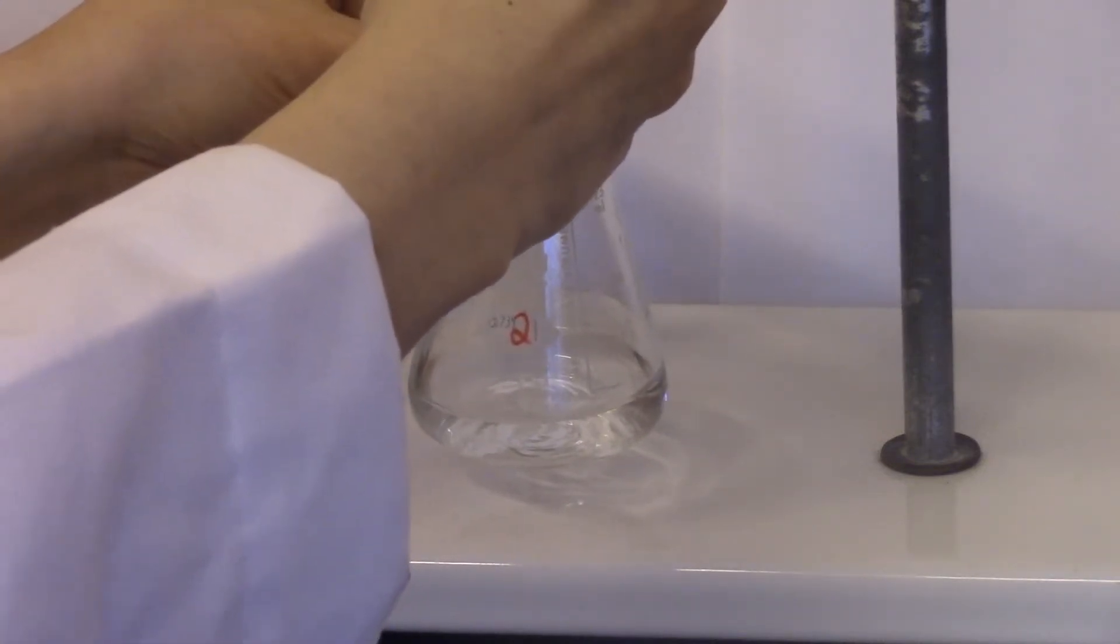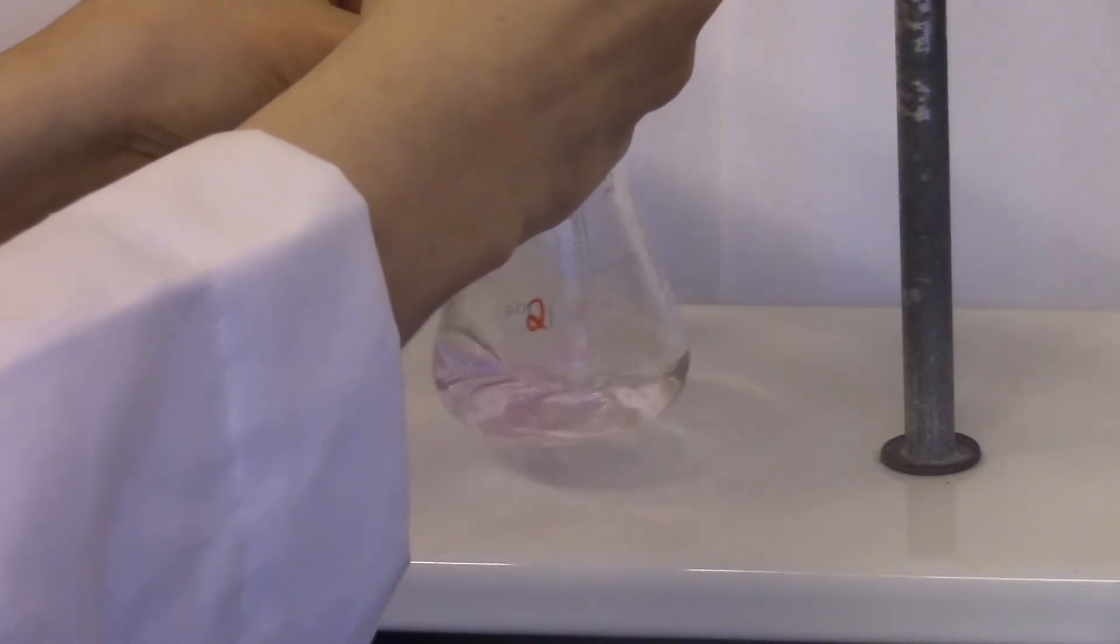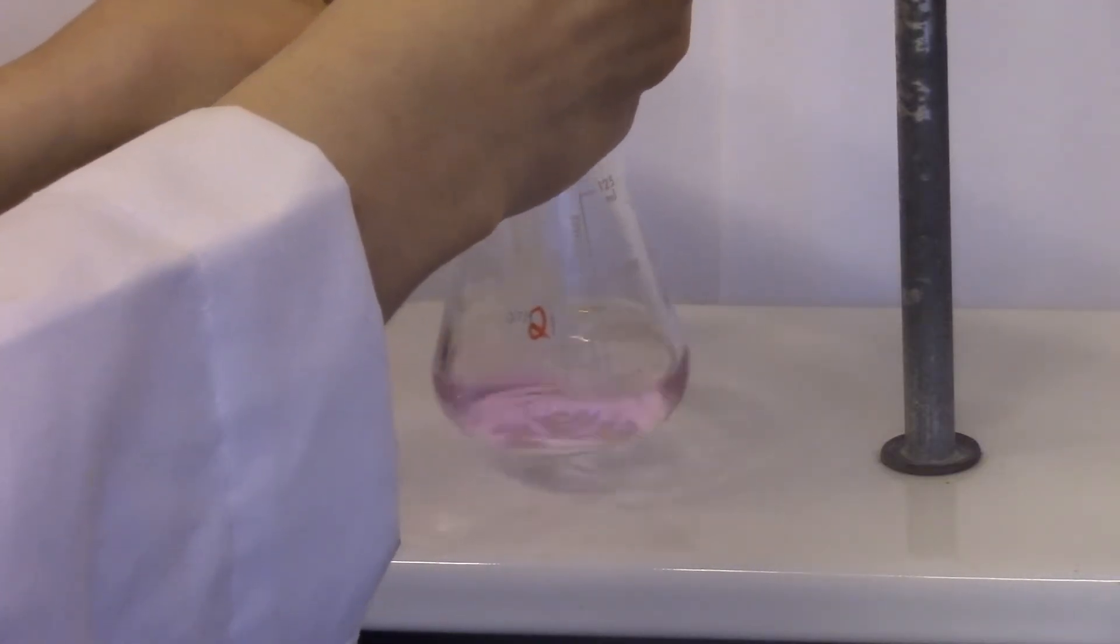Near the end point, carefully add one drop of base at a time, till the pink color stays for at least 30 seconds.